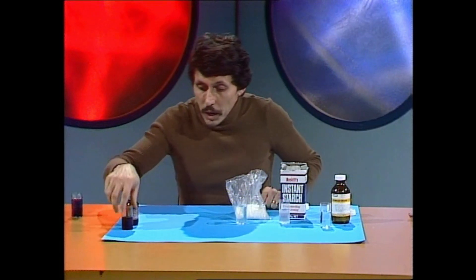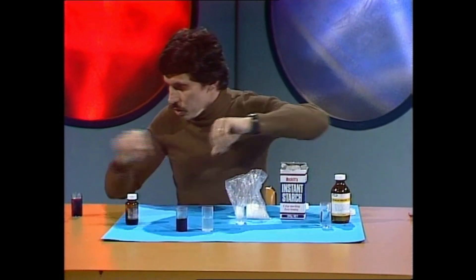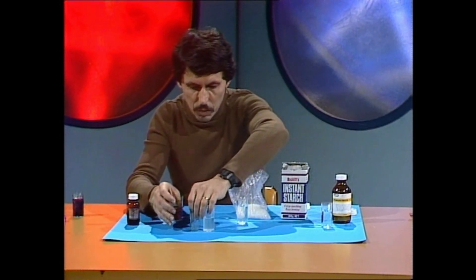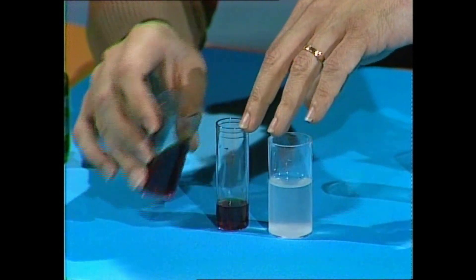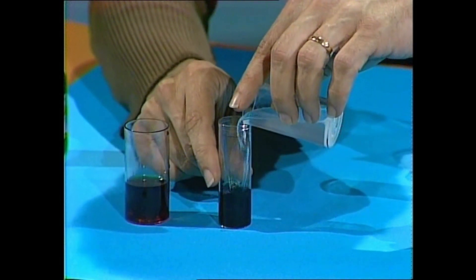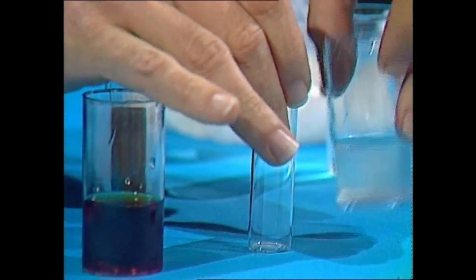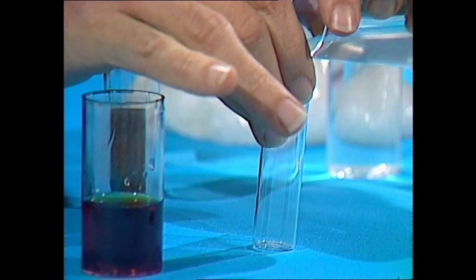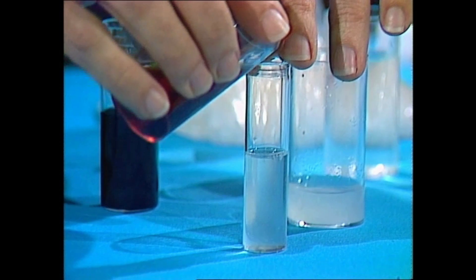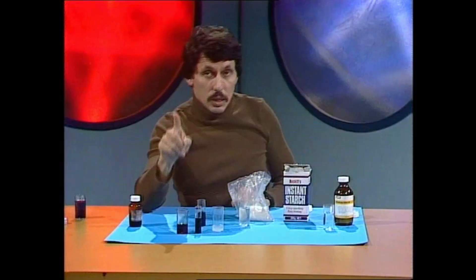Now, the first thing you need to know is something about iodine and what it does when it comes into contact with starch. Let's mix a little bit of each in one of these tablet tubes — a little bit of iodine — and whenever iodine comes in contact with starch, watch what happens: you get that deep blue color. If we start with starch and add just a little bit of iodine to it, we get this deep inky blue-black color appearing straight away.